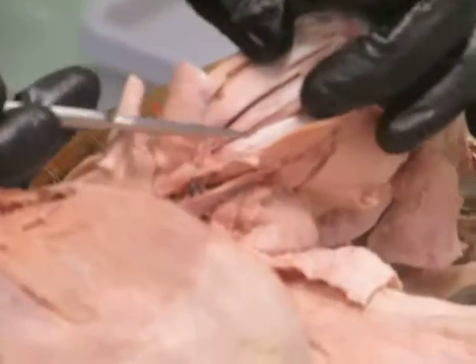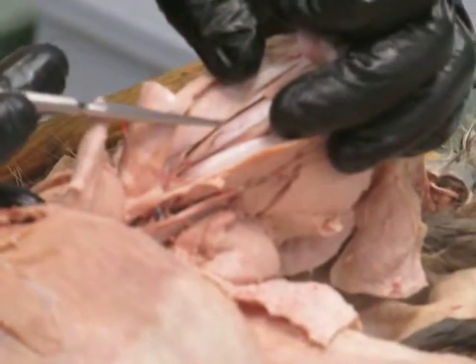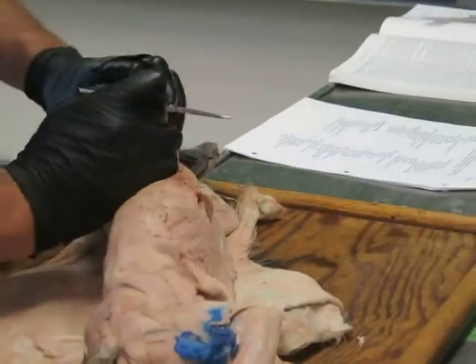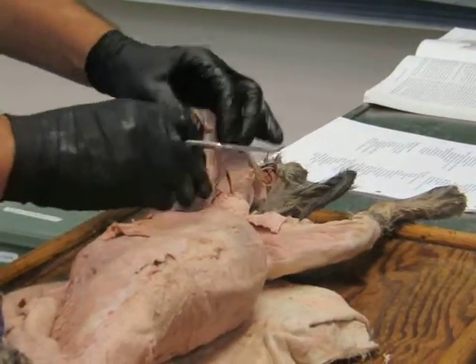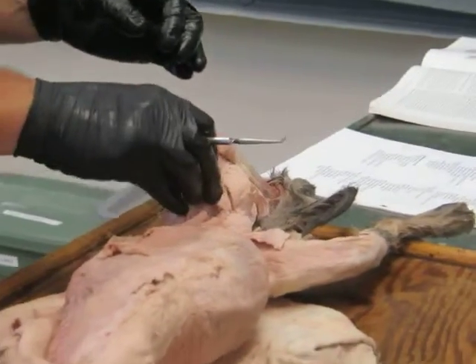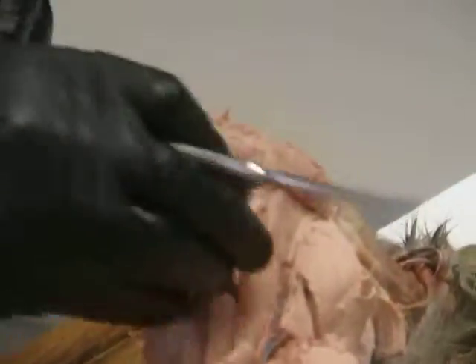Cut that and look deep to it. You see there's another muscle down underneath there, and that's the vastus intermedius. Can you see that at all? A little bit. See if I can. Wait, there's my scalpel. Right here. Do you see that? Okay. So that's vastus intermedius. And what's this group of four muscles called on the front of the thigh? Quadriceps. That's the quadriceps femoris, the four-headed muscle of the thigh. It's got four parts.